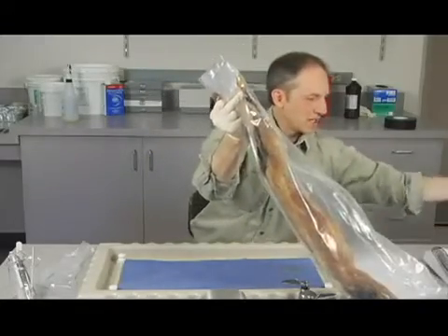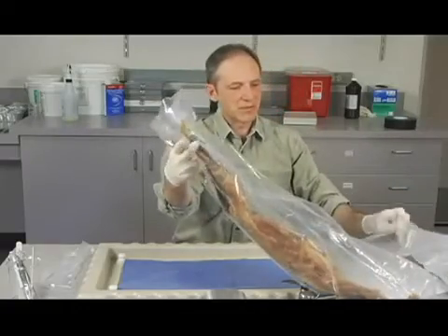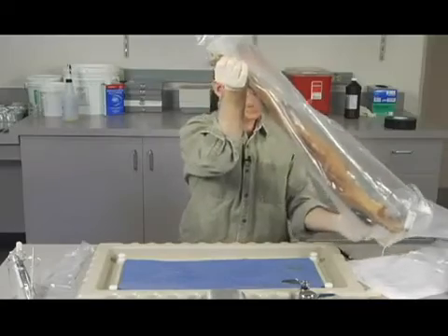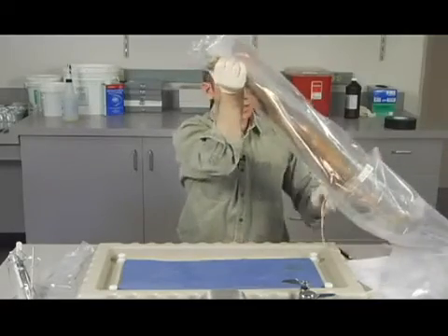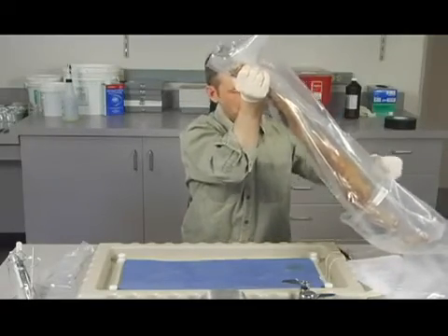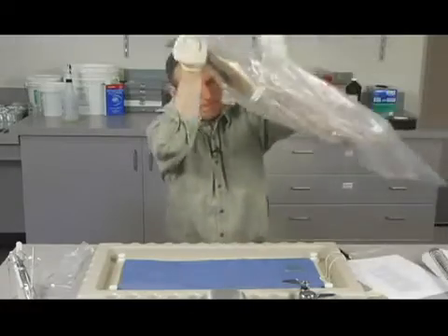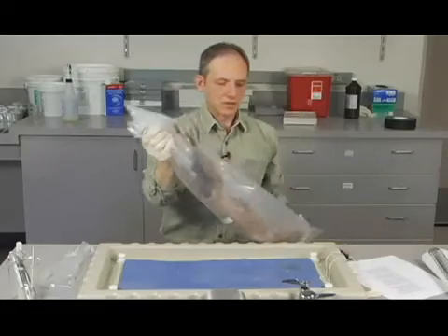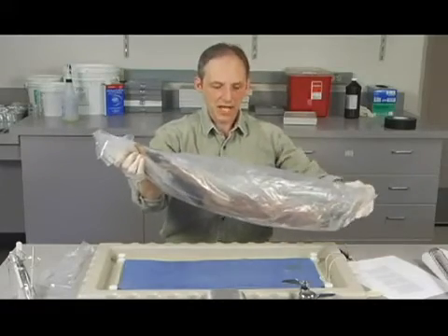We've got another bag, and again, we're trying to keep the fluids and things from getting separated from the cat, so I'm going to try to get it into the other bag. Okay? So that's about it. It's not really any harder than that.